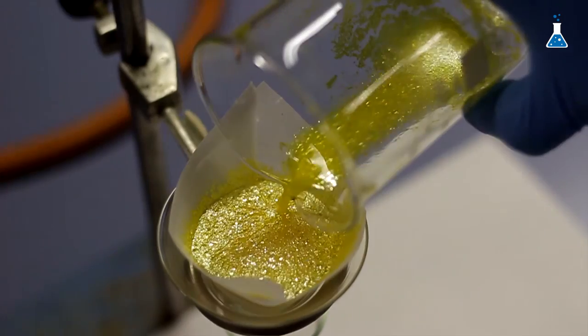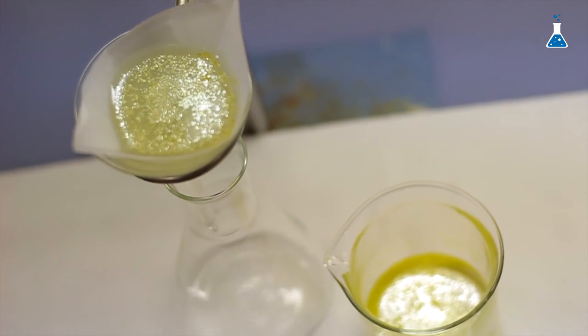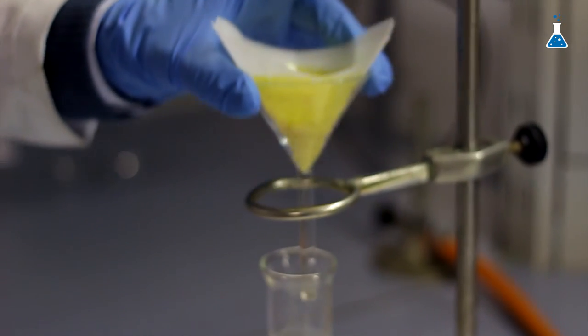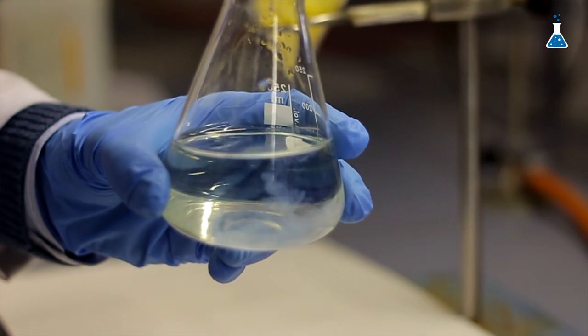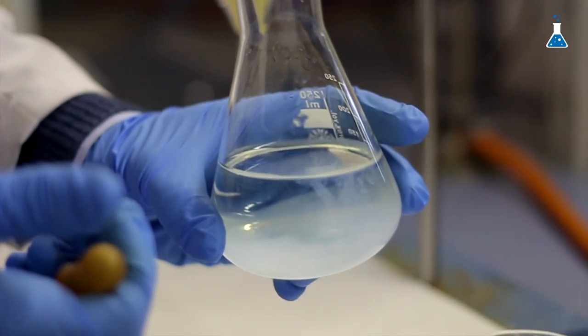Once we have finished the experiment, let's filter off the precipitate by gravity and dispose of the mother liquor in a toxic waste container. Not only is it necessary that the yellow lead iodide precipitate is properly disposed of, but we also need to remove any lead content that may still be in the mother liquor or on the glassware that was in contact with lead during the demo. In order to do that, we are going to employ a saturated solution of sodium bicarbonate and add it to the mother liquor. A white precipitate is formed, which indicates that there was still some lead present, because although lead iodide is insoluble given its solubility constant value, there is a very small amount of lead still dissolved.